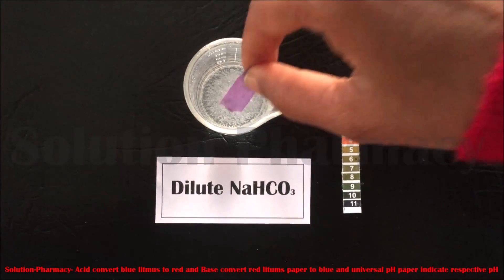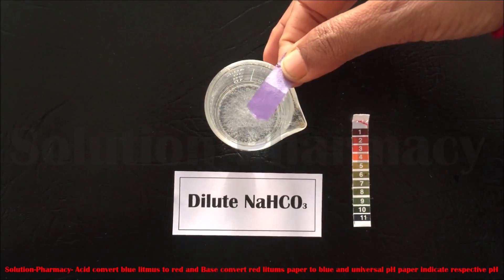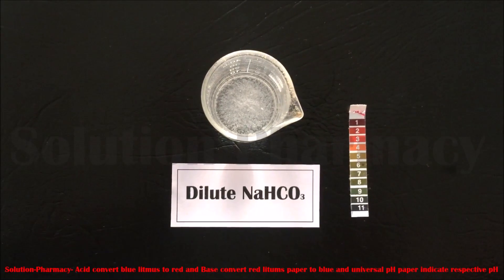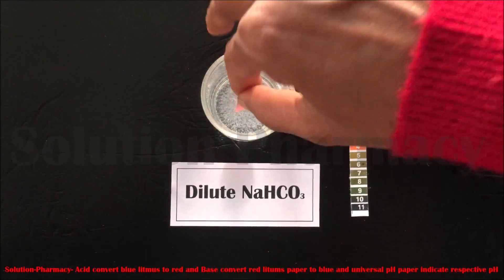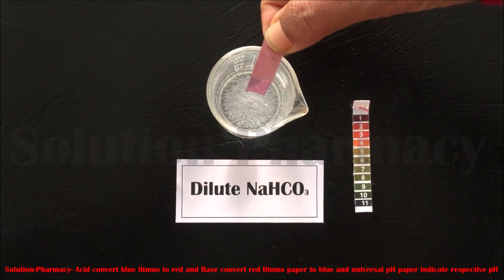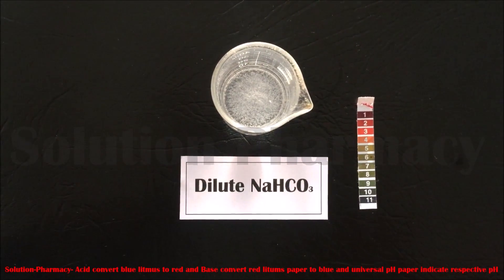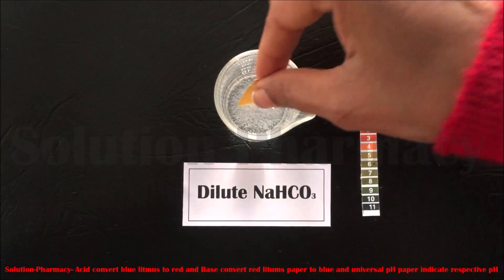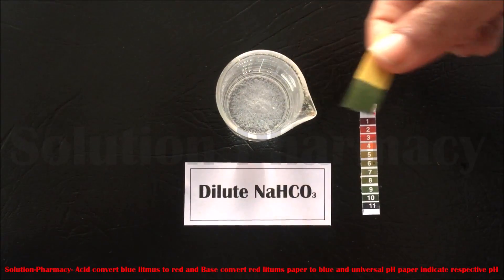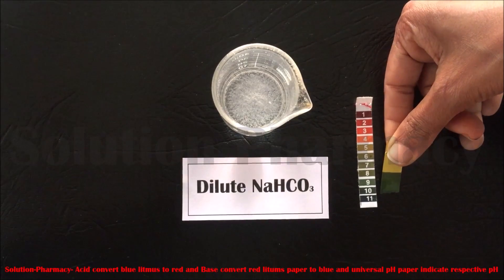The next sample is dilute sodium bicarbonate solution. Dip the blue litmus into it — there is no color change in the blue litmus paper, which means it is not acidic in nature. Next, dip the red litmus paper into it; the red litmus paper changes to blue, which means dilute sodium bicarbonate solution is basic in nature. Now dip the universal pH paper into it. The color change matches the color of pH value 9.